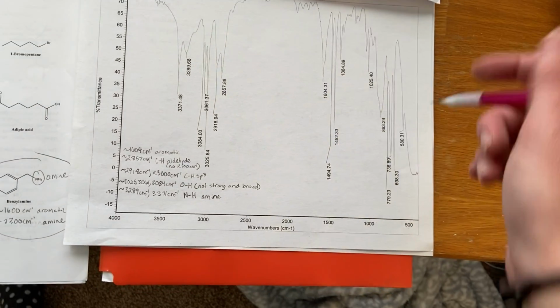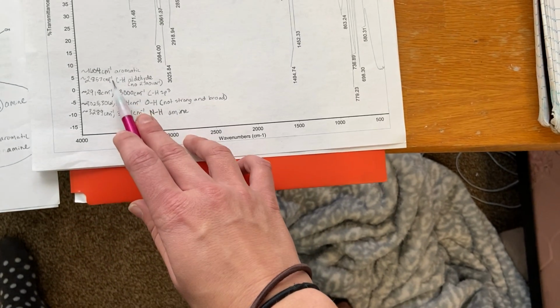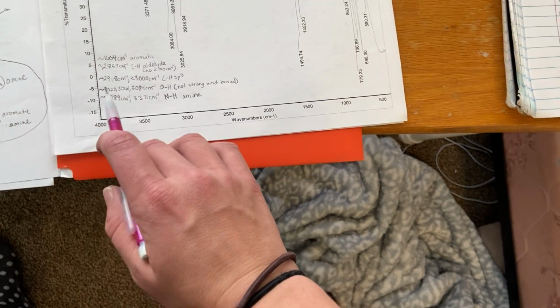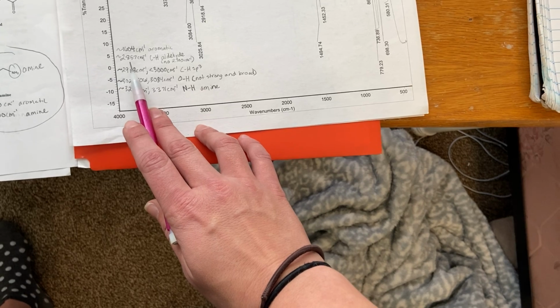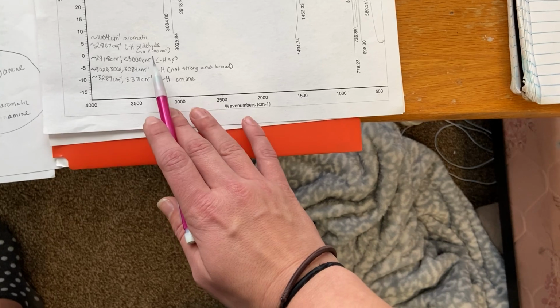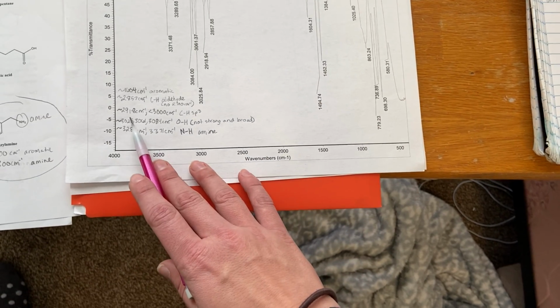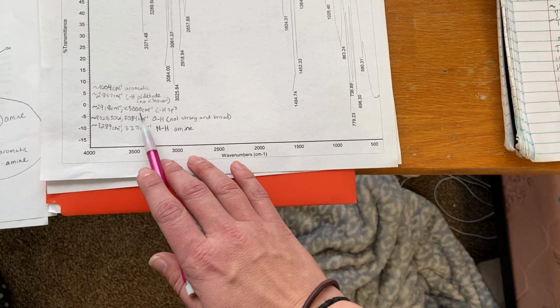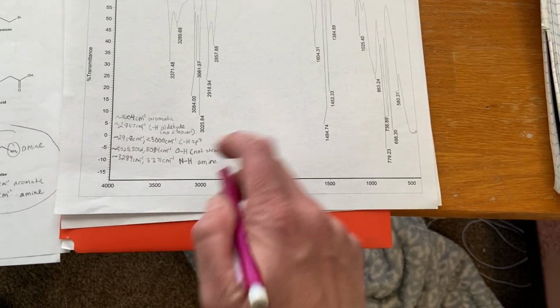spectrum summary for IR, we see a peak at around 1604, which means that our compound is aromatic. We also see a peak around 2857, which represents a C to H aldehyde. But since there is no peak around 2700, this cannot be an aldehyde. There cannot be an aldehyde in this molecule. And then there's also a peak around 2918, which is just below 3000, and this would be a C to H sp3 hybridized. And that would be seen in the molecule.